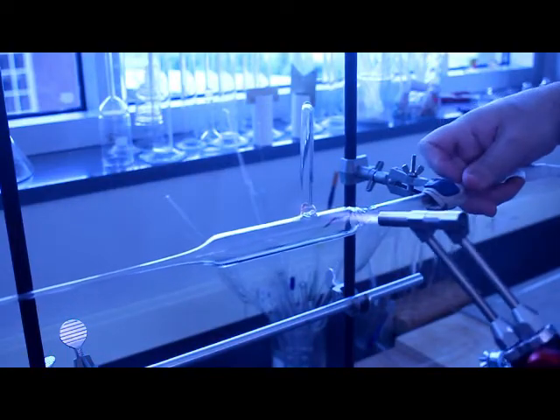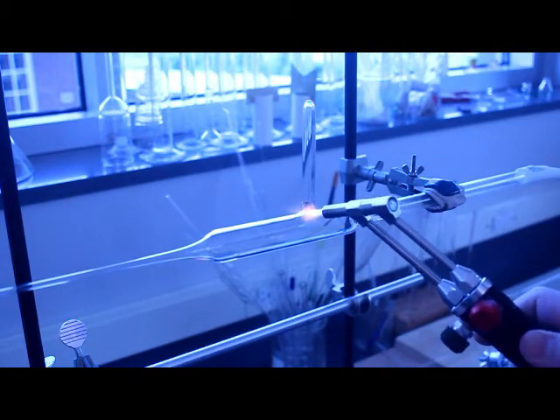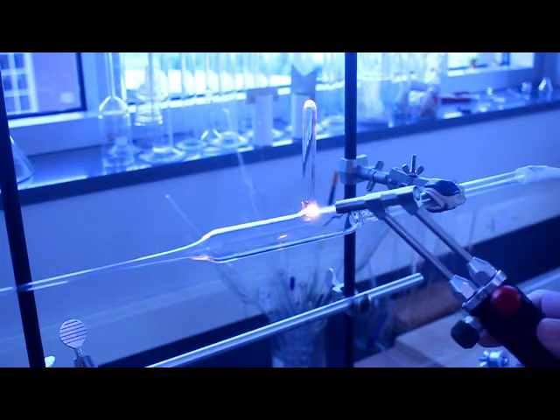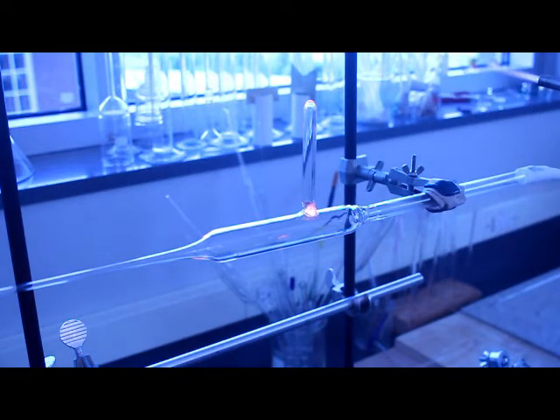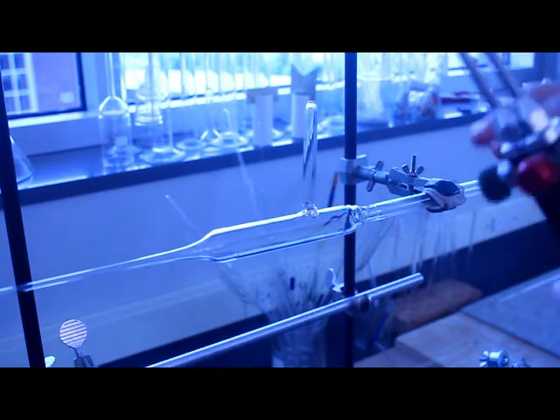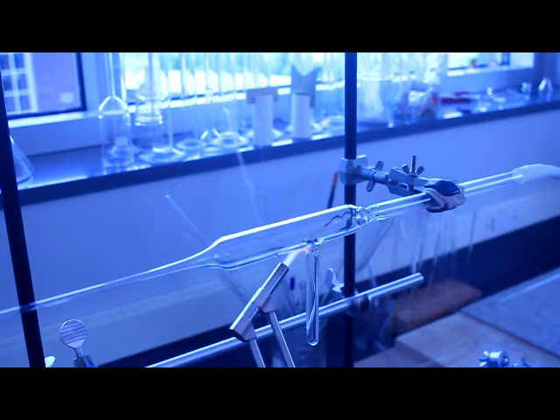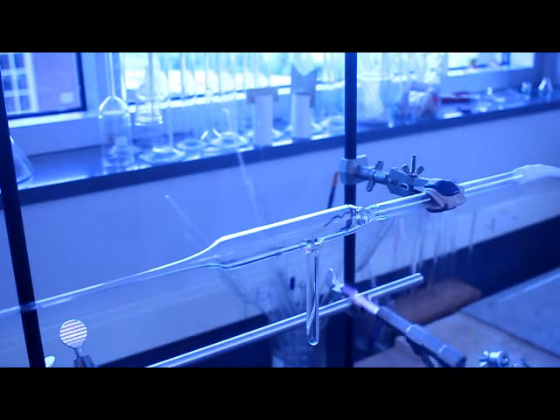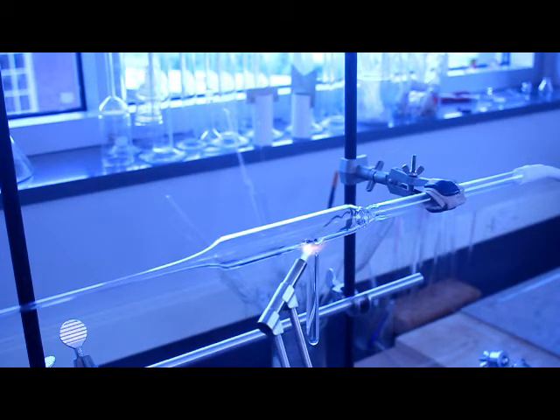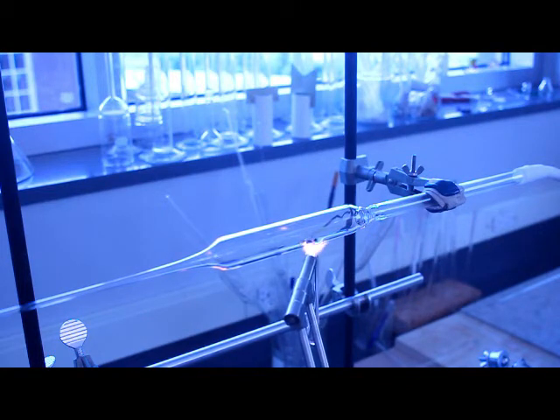This is something where I'm going to spend a lot of time working to clean up this weld, to make it as uniform as possible and as straight as possible. Another mistake I'm making right here, you notice how the tube I'm having to just nudge it back into place. Again that should be secured or I should pay more attention to holding it into place. As a test piece I'm not caring about it too much, I'm more focused on just getting this put together without it breaking on me. I've had pieces again when I was first doing this in grad school when at this stage because the weld was so bad and I didn't keep the piece uniformly heated, it would actually crack and just break apart. So again that can be incredibly frustrating when you're doing it. As bad as I am right now I am light years ahead of where I was much earlier in my career.